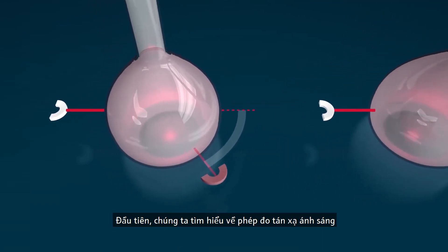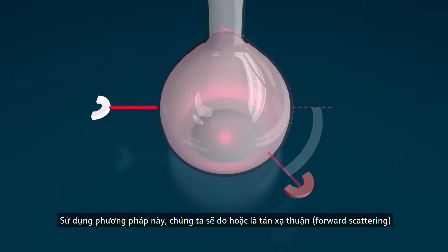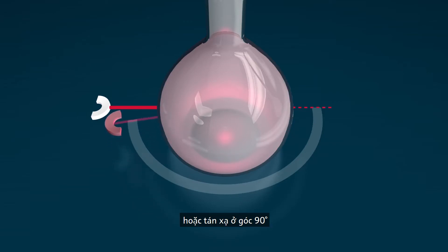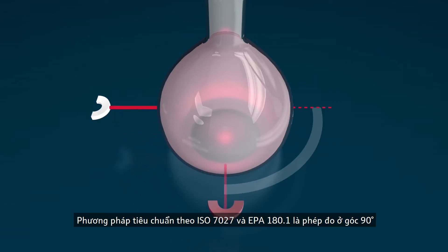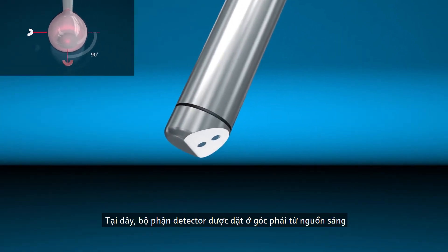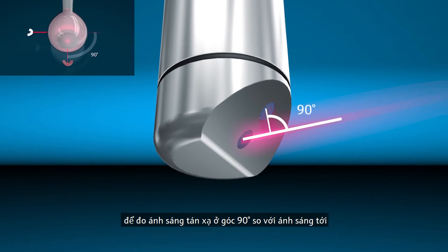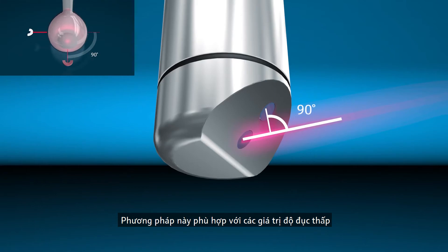First, let's take a closer look at scattered light measurement. Using this method, either forward scattering, backward scattering, or 90-degree scattering is measured. The standard method according to ISO 7027 and EPA 180.1 is the 90-degree measurement, where the detector is positioned at a right angle from the light source to measure the light scattered at 90 degrees from the incident light. This method is suitable for low turbidity values.